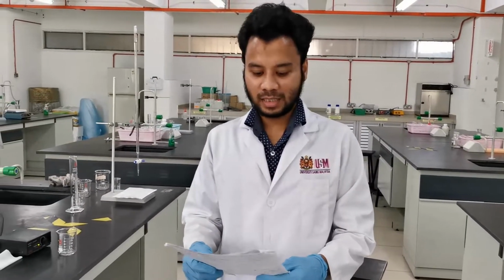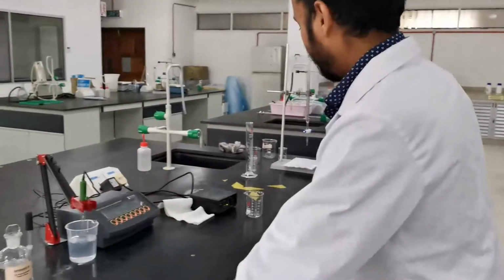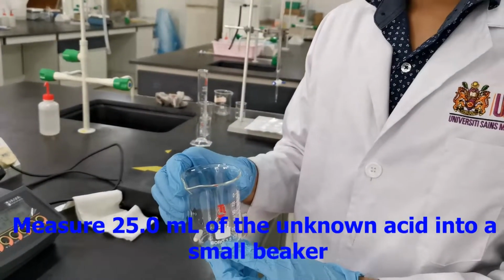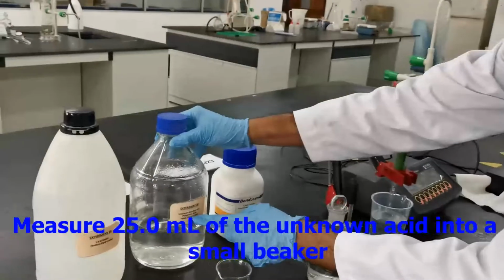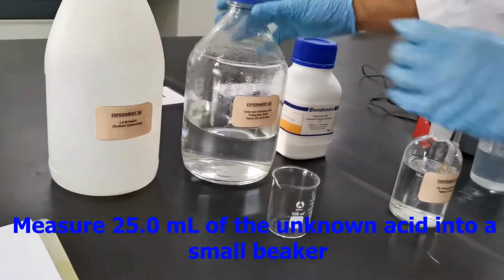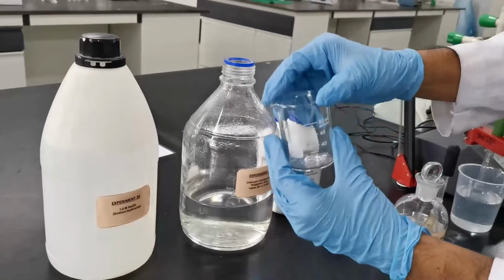So part B is the determination of the acid dissociation constant and the molarity of an unknown acid. For this one, we will use a beaker of this size, 150 ml. First of all, you need to measure 25 ml of the unknown acid. The unknown acid is a polyprotic acid. Since this container is large and difficult to handle, better you transfer it into a beaker of this size.